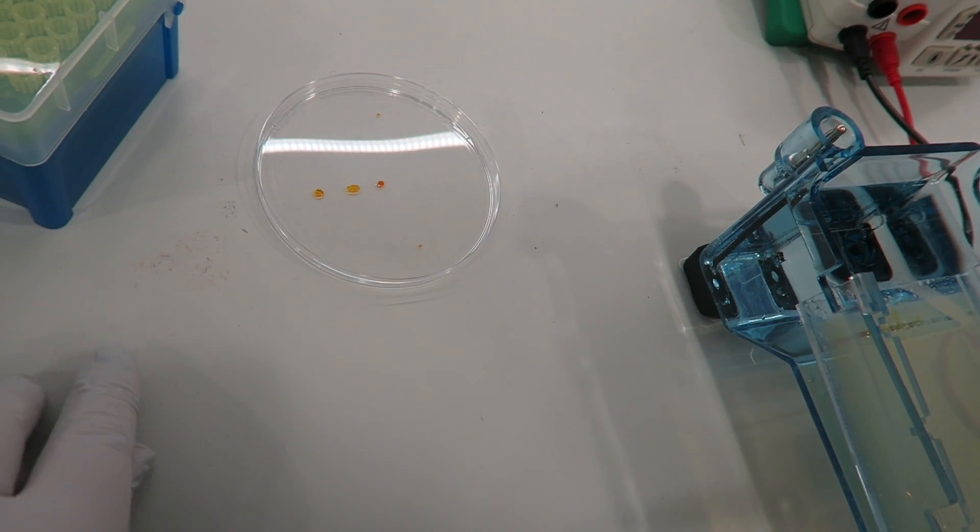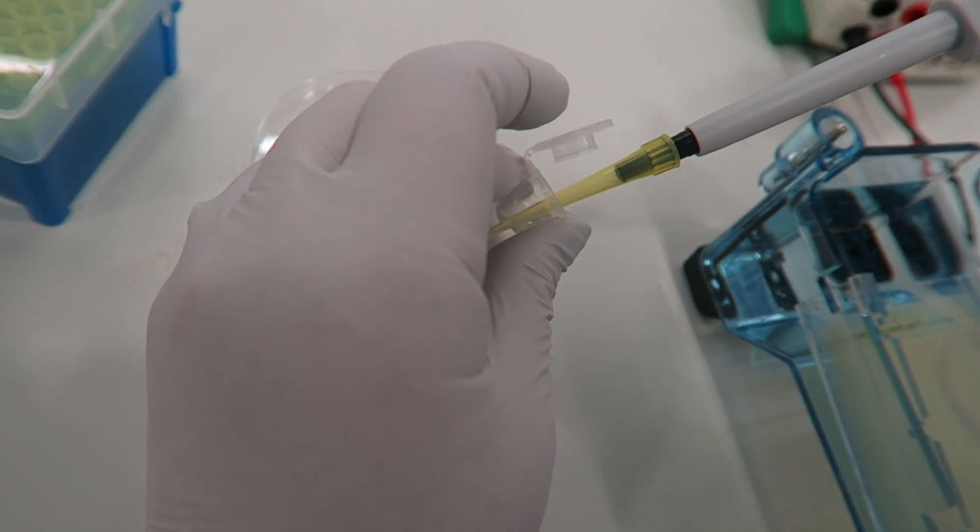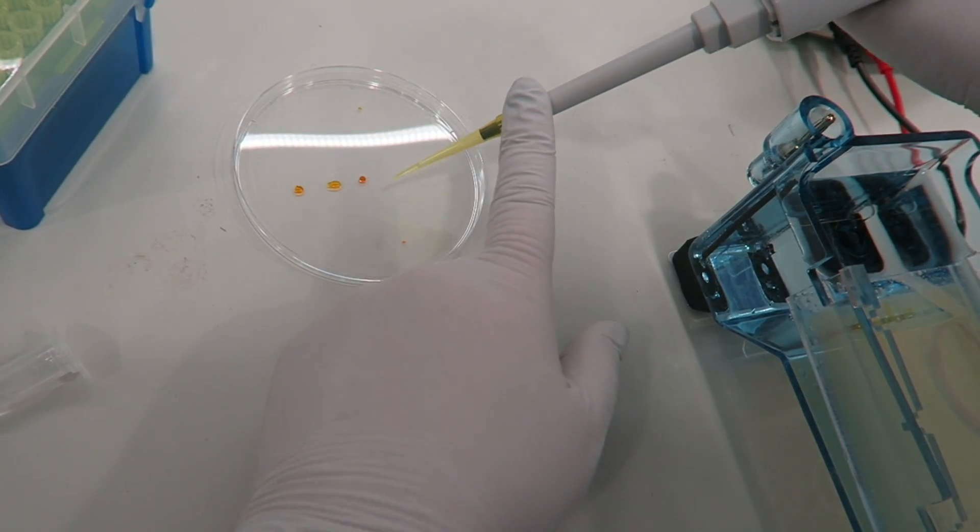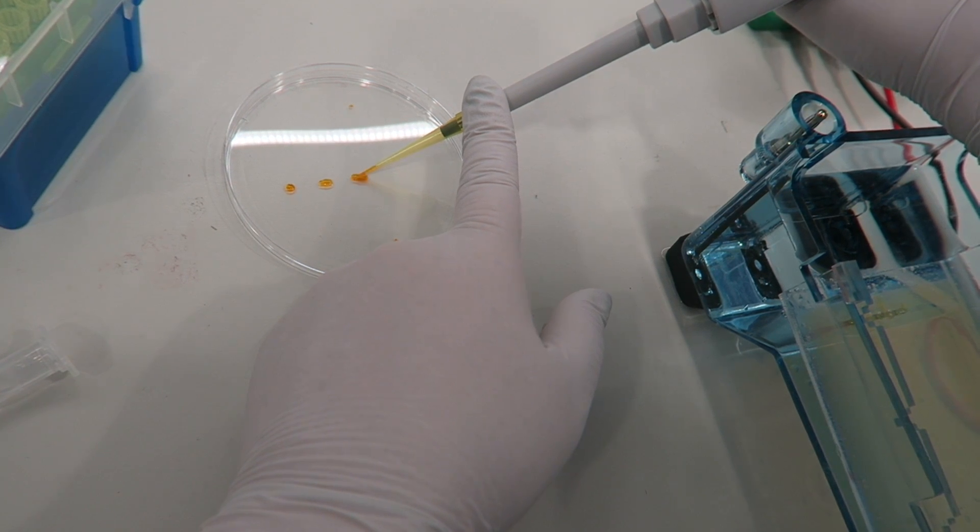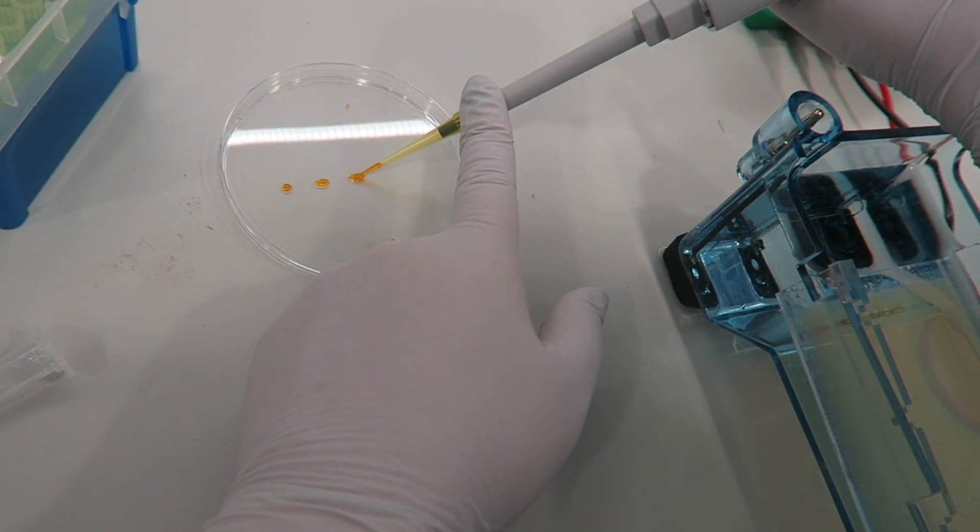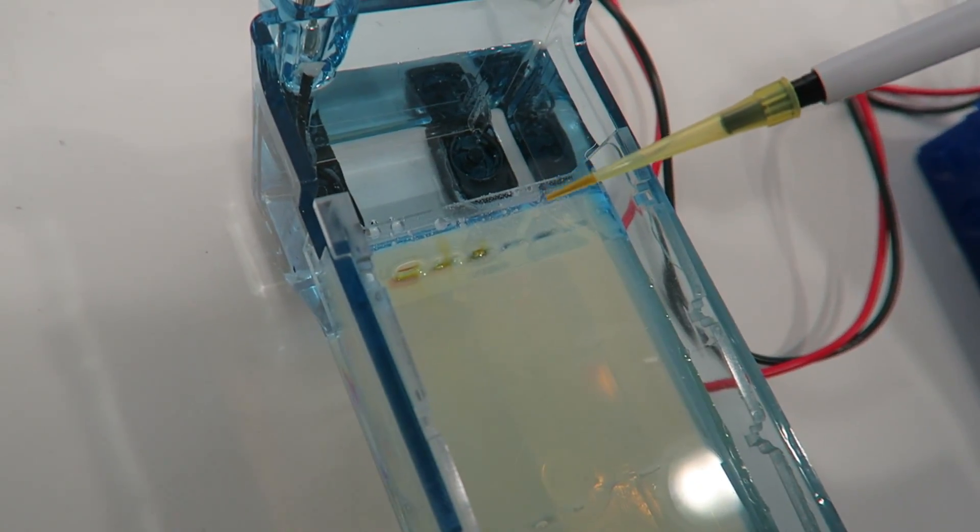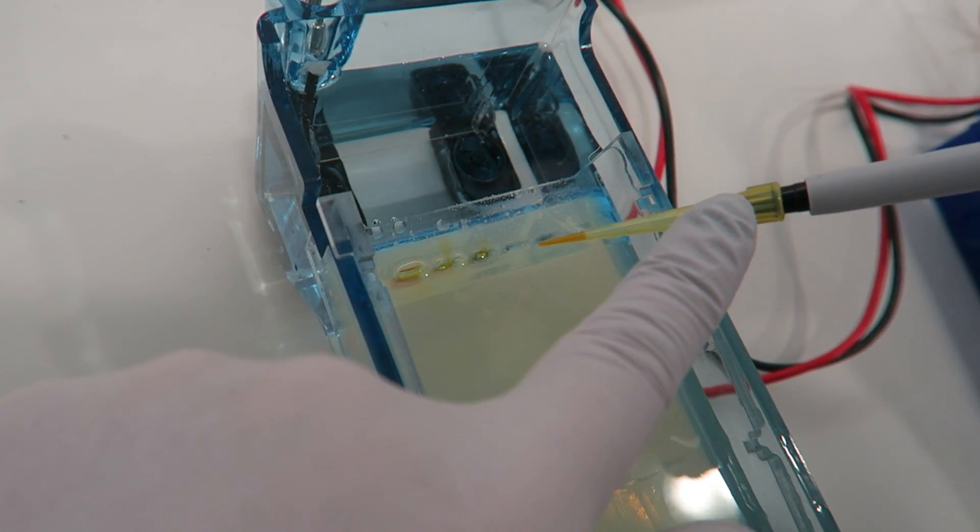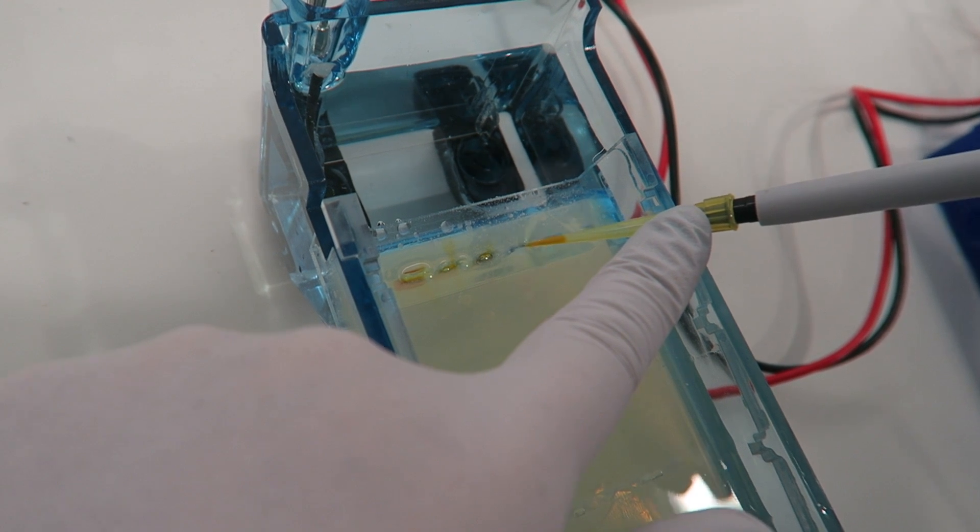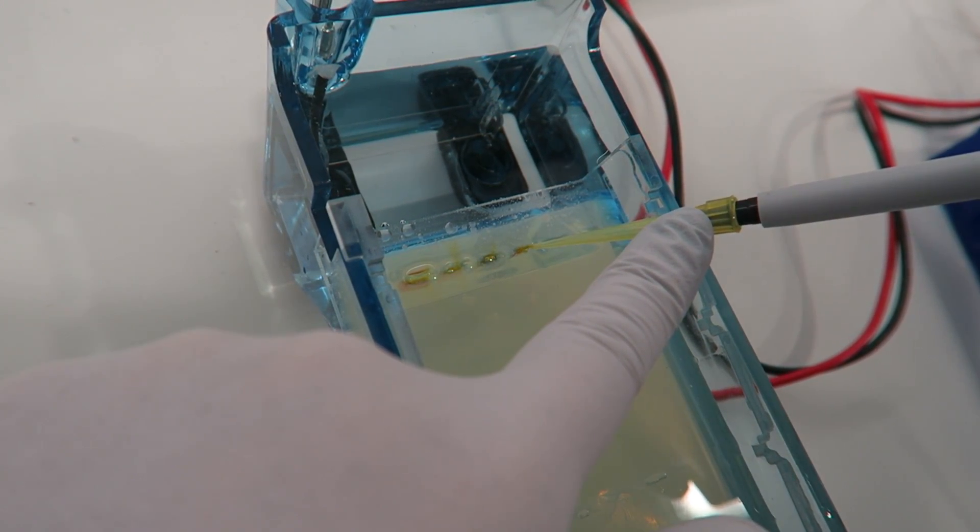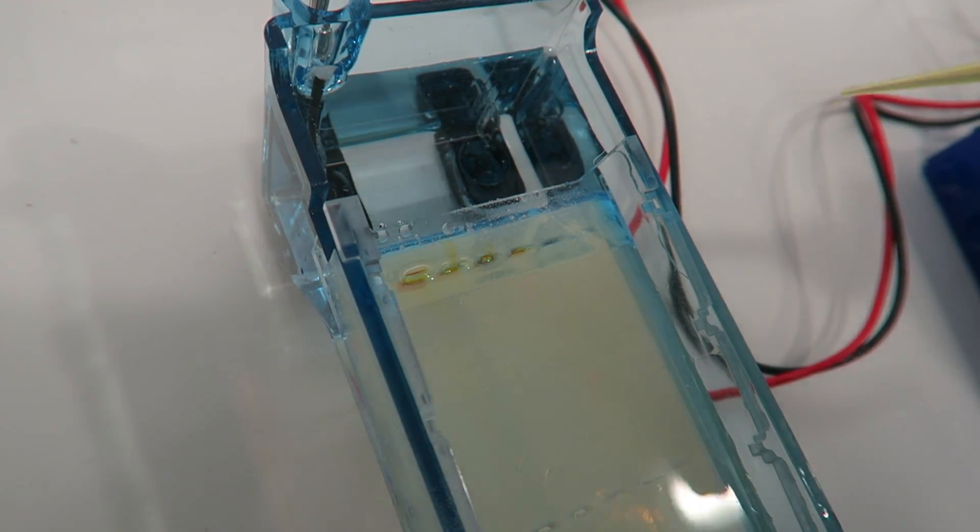This is a skill. It takes a large amount of practice to do this. I spent years in the lab pipetting and loading gels. It is very tricky to get the pipette still and to get a small volume into such a small place.